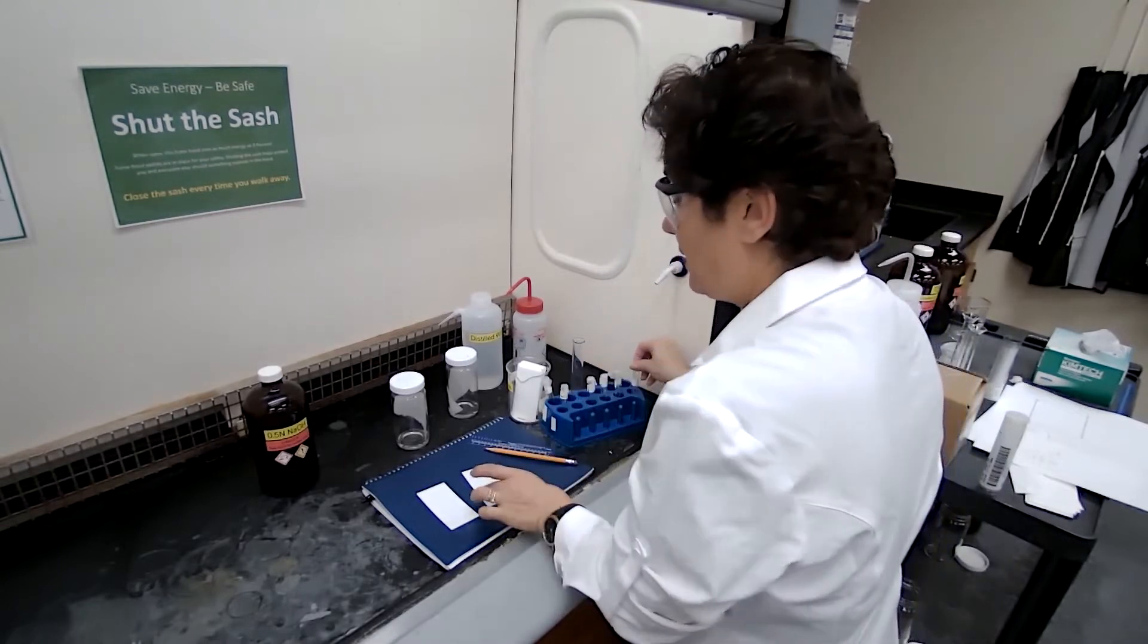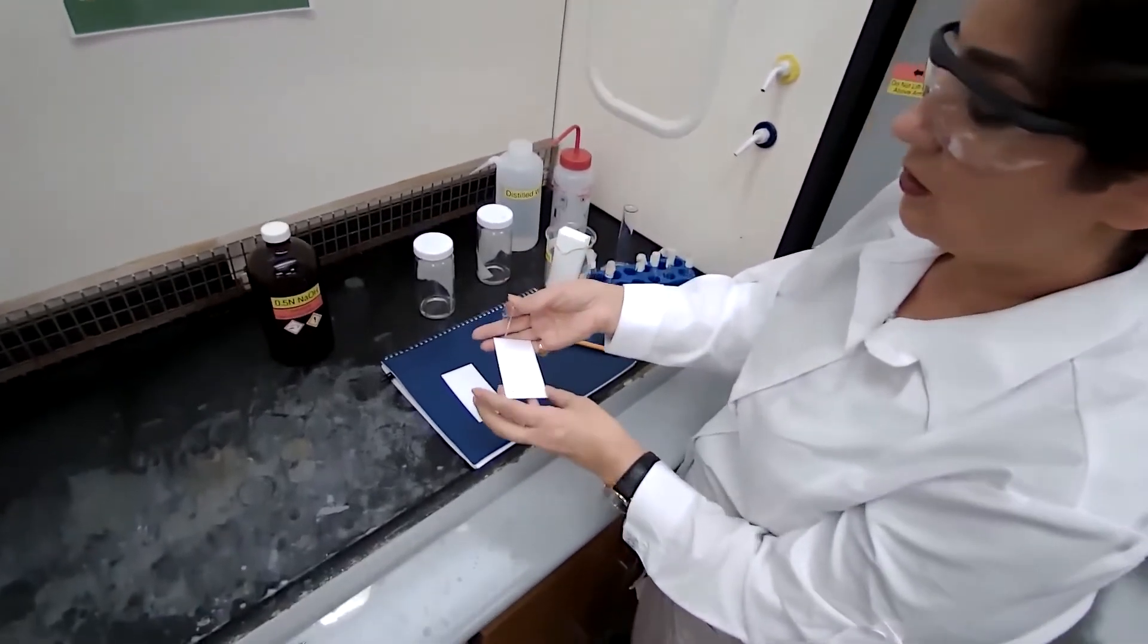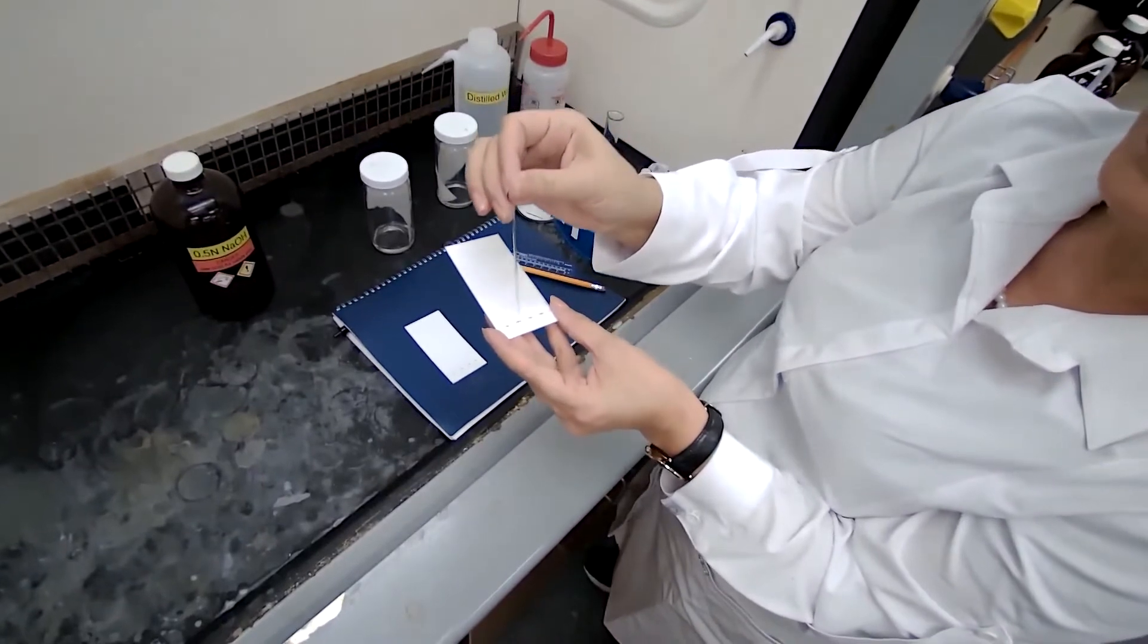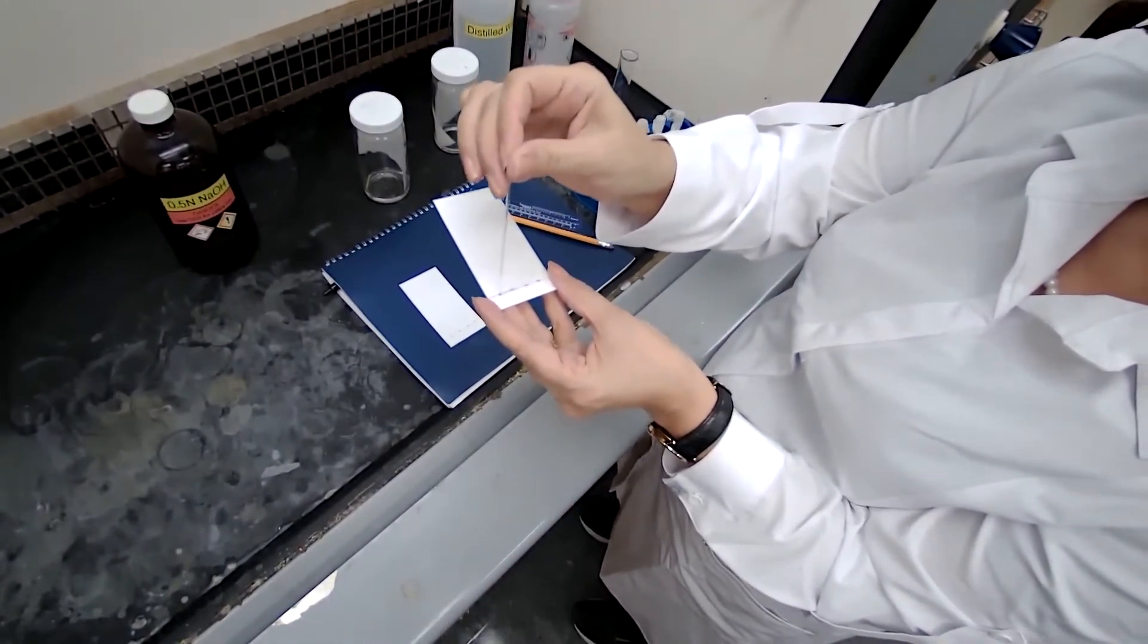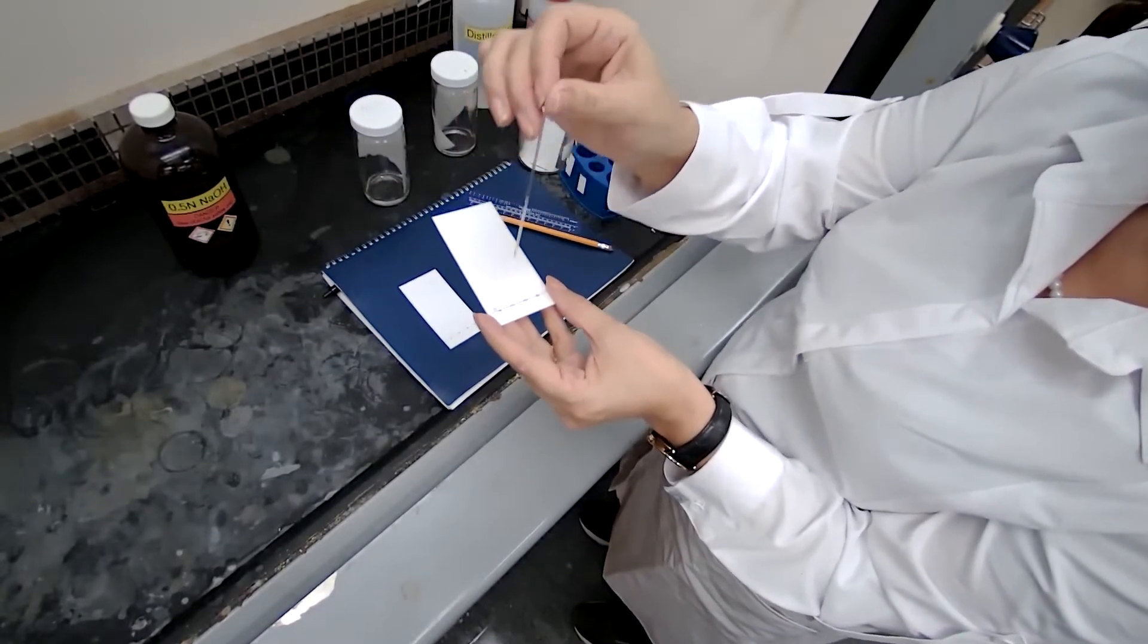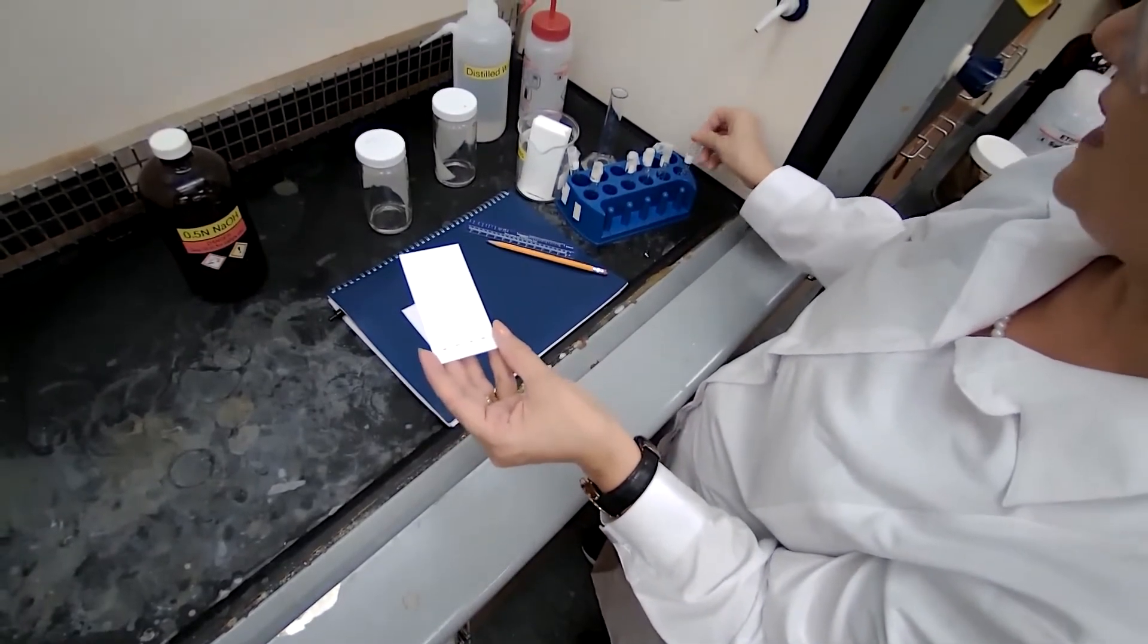As they develop, if it's too small we cannot see it. So what I do, I just use a capillary tube and place it in the liquid, the solution that is already prepared by the lab for you. You are going to place the sample and just touch the line or touch the spot.